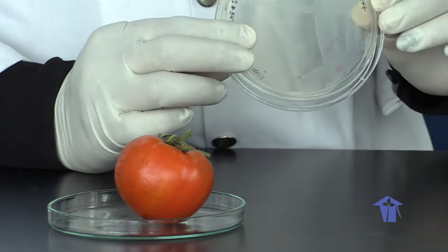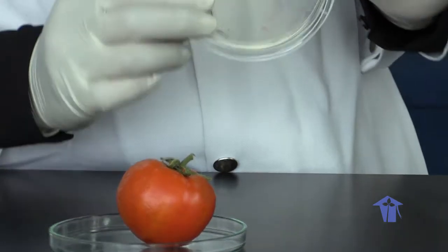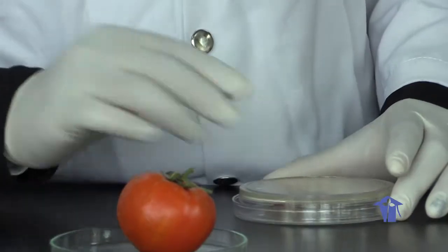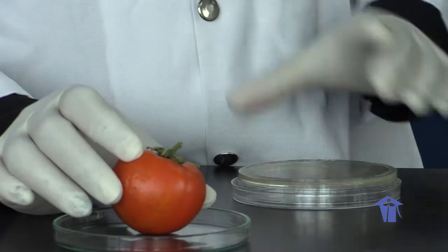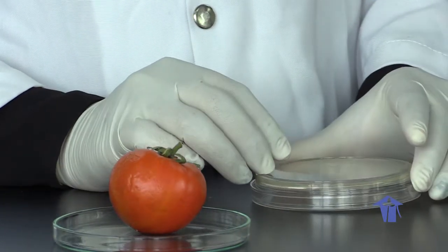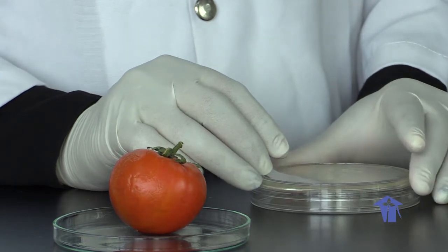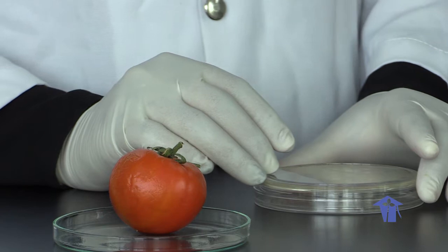We are going to take a sample, a pure culture colony, from this sample that has grown, and we will be re-inoculating it into a healthy tomato. We are doing 2 inoculations. One of them is going to be with the unknown organism. The other we will be using as a control. So we'll be inoculating a tomato with just distilled water for comparison in this lab.